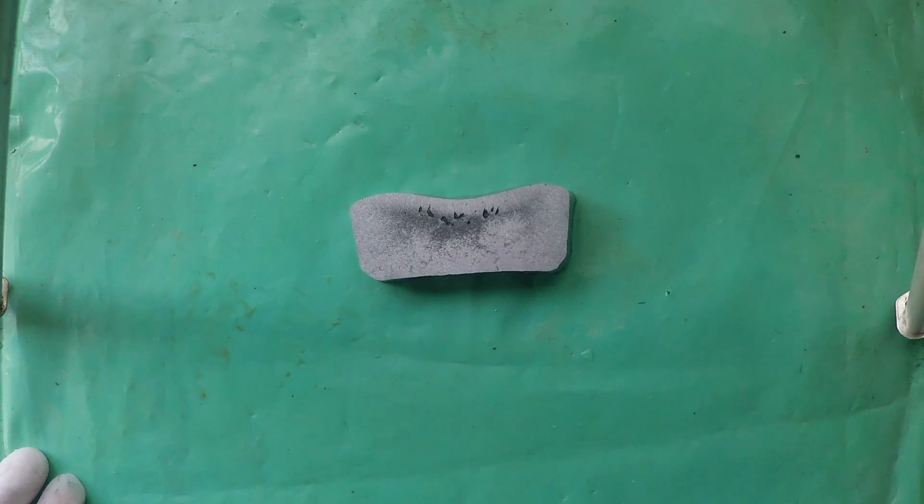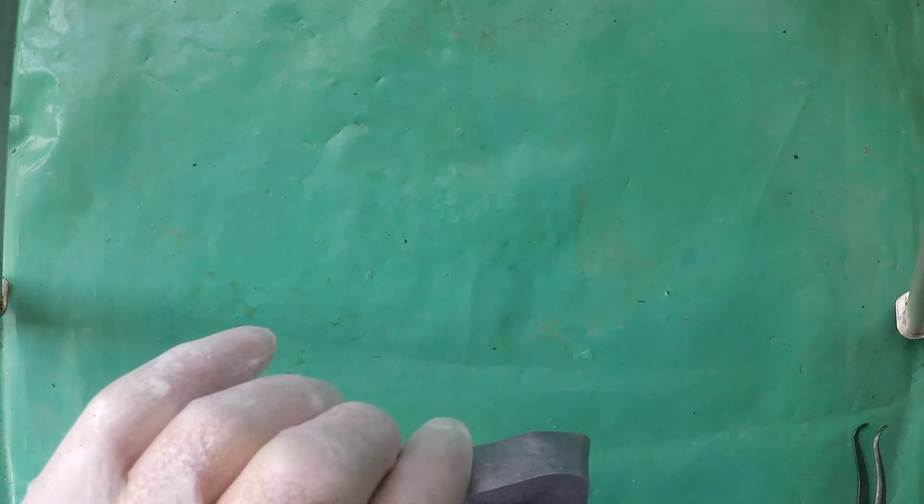So some of it would have frozen against the air too up here. And slowly we would work to the last liquid in the patch here in the middle with all the greys and all the shrinkages. But I'll now take the close-ups of this. Then we'll lightly sand it and take some more close-ups.